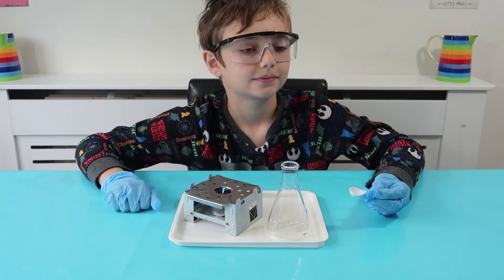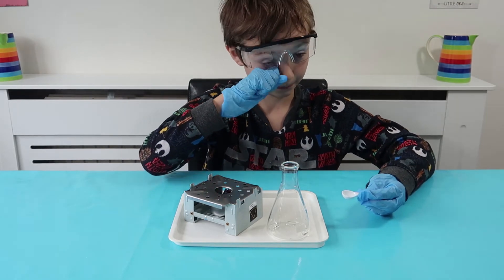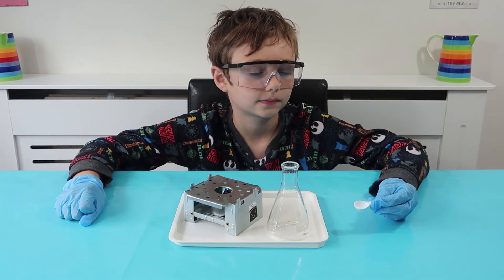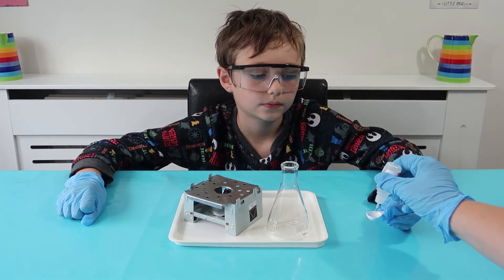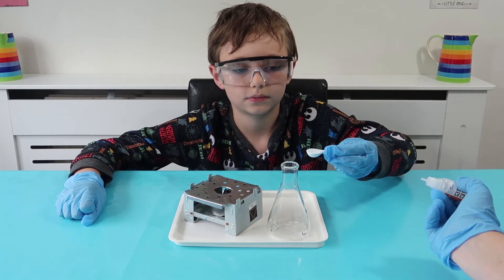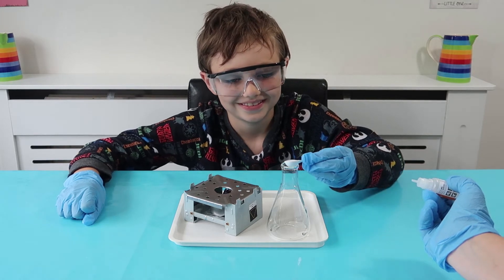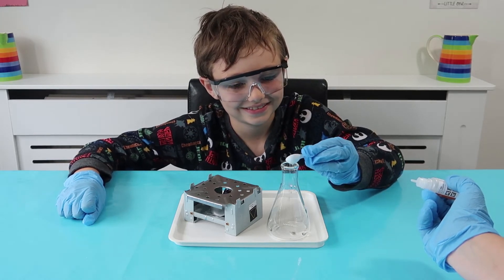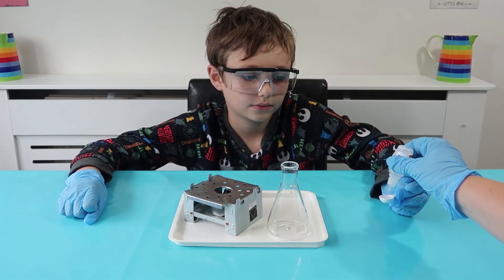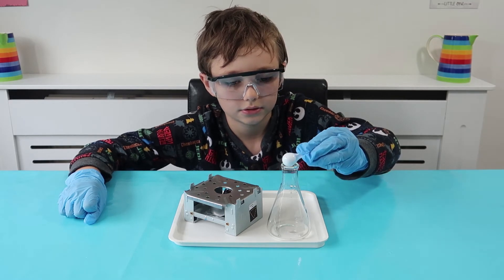It's very technical and scientific when you do that! Okay, and then we need to put in two large spoons of citric acid. Are you ready? So one — careful — and two. Pop that in there as well.